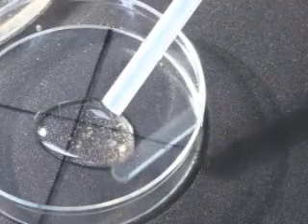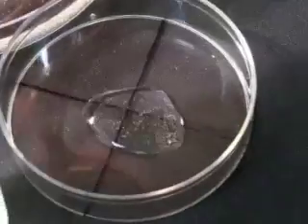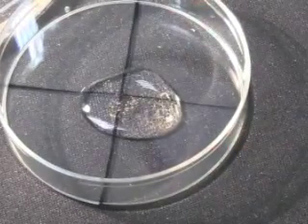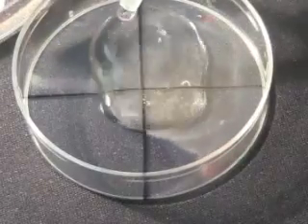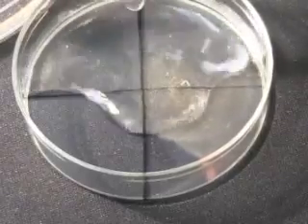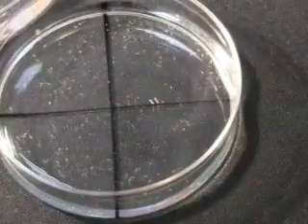Artemia tend to swim rather rapidly and they are going to be hard to count. The way we approach this problem is to use something called methylcellulose, which is generated from tree sap. It's an extremely viscous solution. What you do is squirt that in on top, adding enough so that the liquid covers all the way across the petri dish — this will make counting much easier. When you've almost got enough, just give it a swirl to close any air pockets, and that will slow them right down.